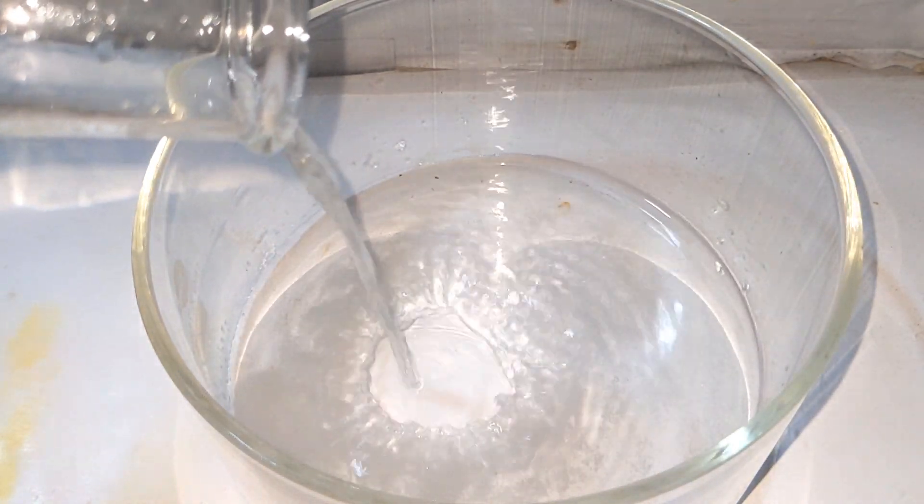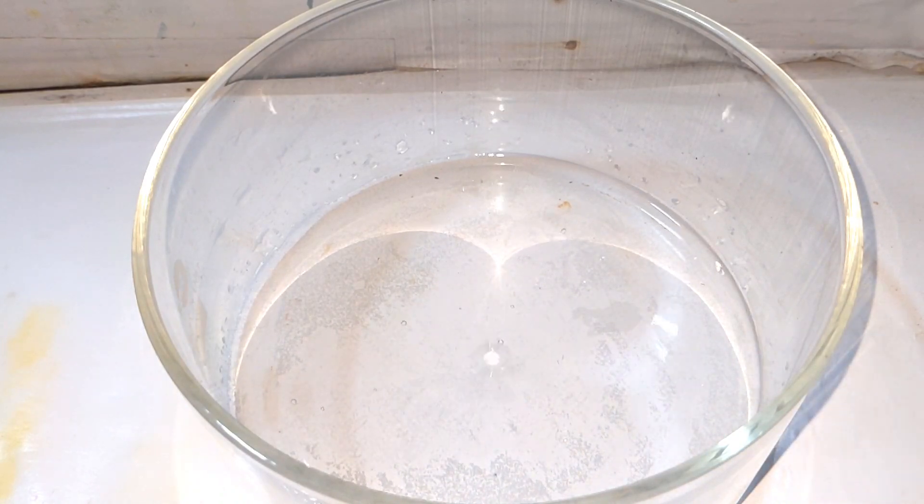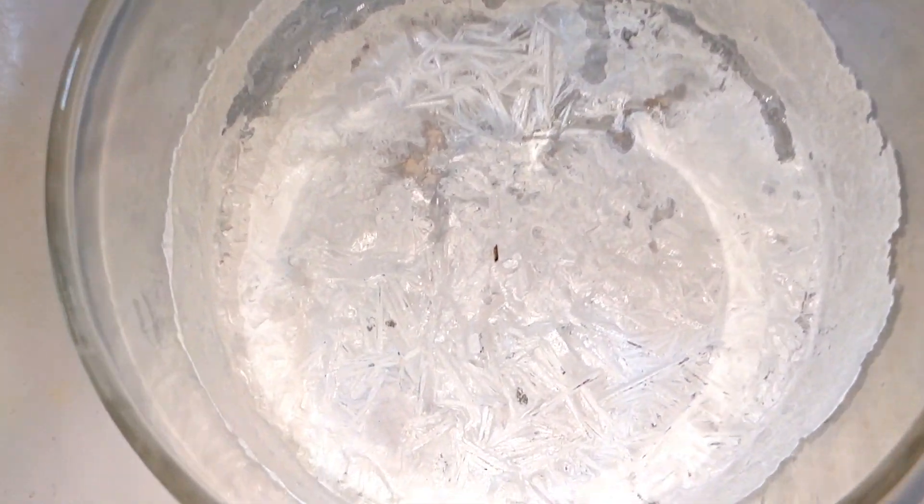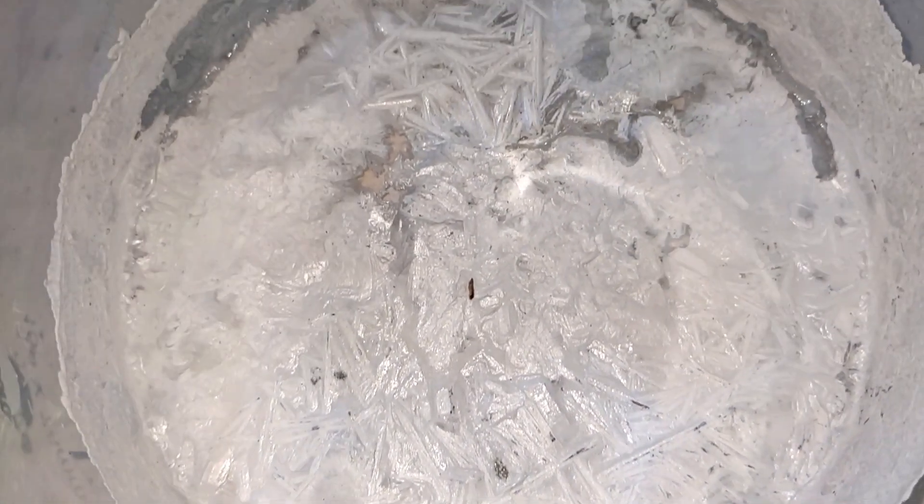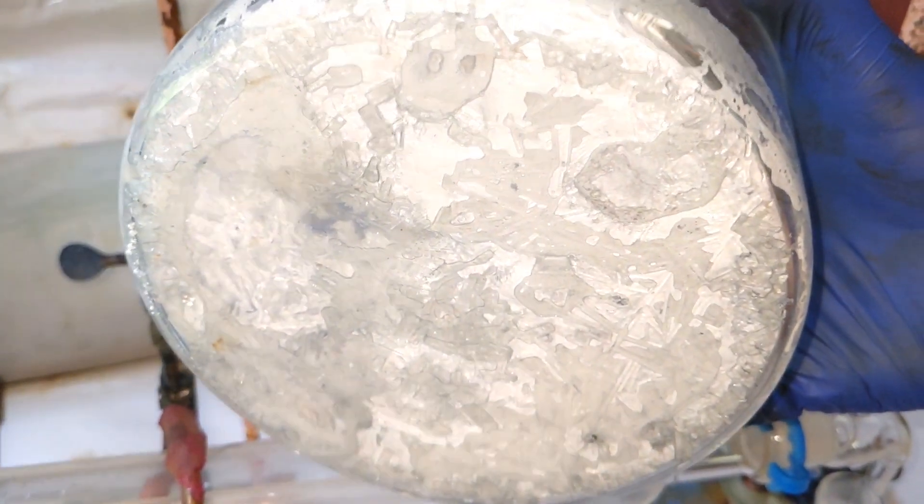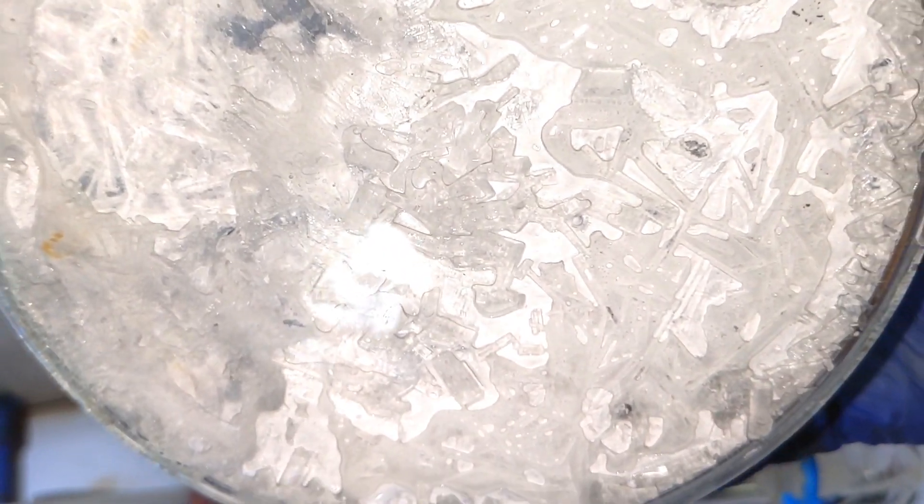I placed it outside and because of the high temperature and wind it quickly evaporated and even though the crystals were formed there was a lot of crust formed along with it. So the crystals were actually distorted and was not so beautiful. You can see the monoclinic crystals at the bottom of the crystallizing dish but a lot of crust was there.